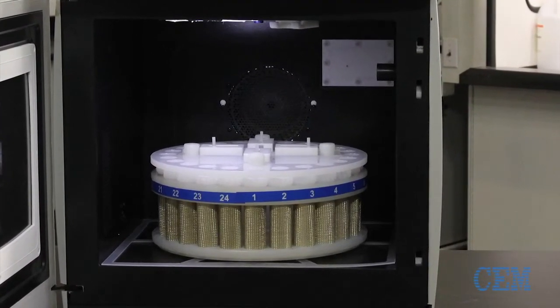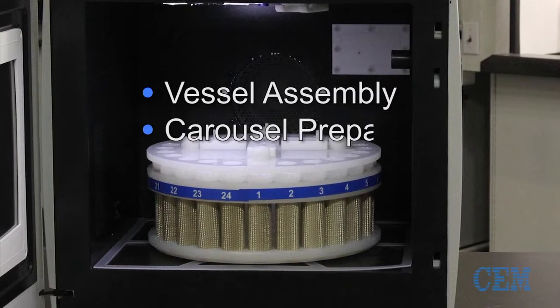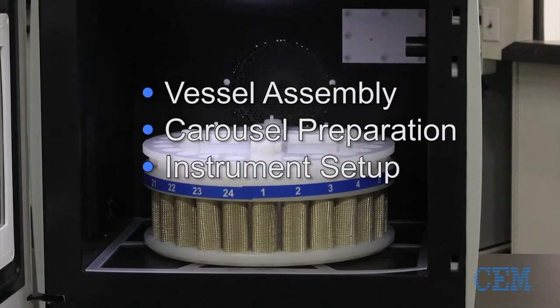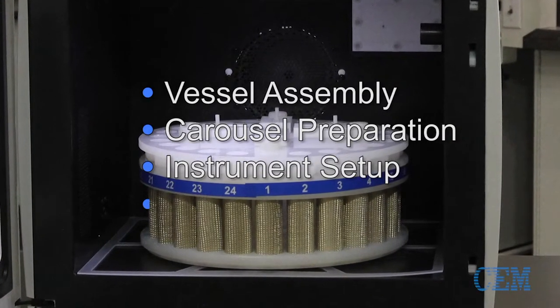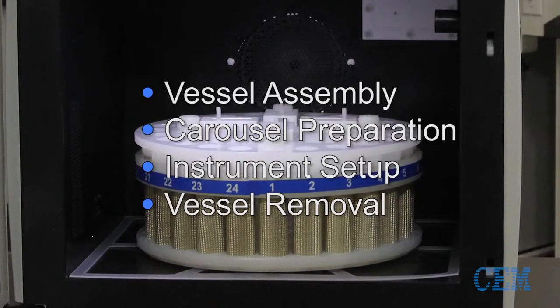This video will show you how to assemble the vessel, prepare the carousel, set up the MARS-6 microwave system, and how to safely remove the vessels after synthesis is complete.